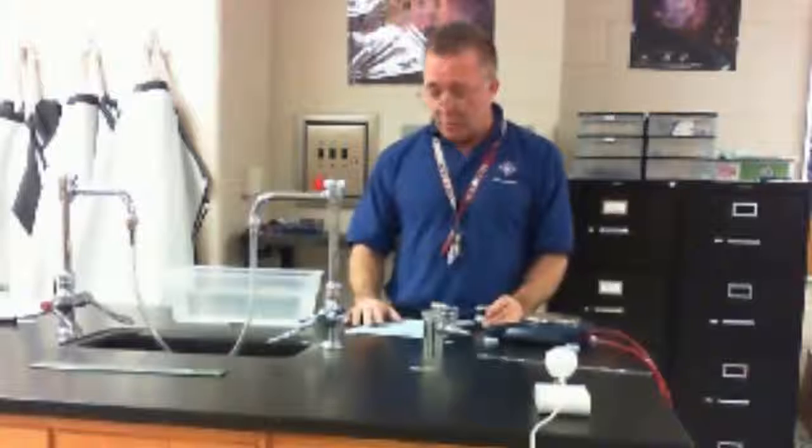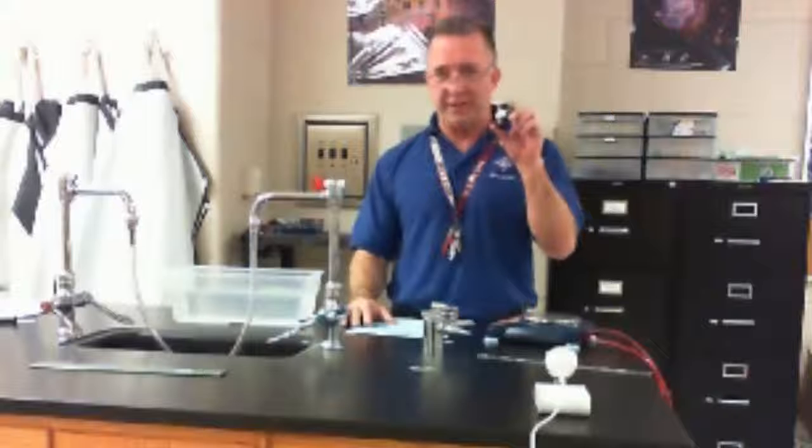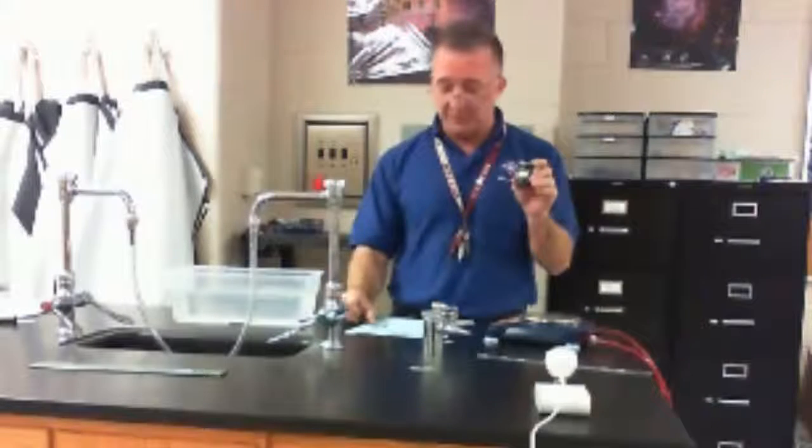All right? So how this is challenging is the groups, and we'll have 2 people per group in a class, the groups with the highest amount of sand will get the highest grade. And I actually told them the number 1 group will get 105. Everybody else will be based off of that benchmark.